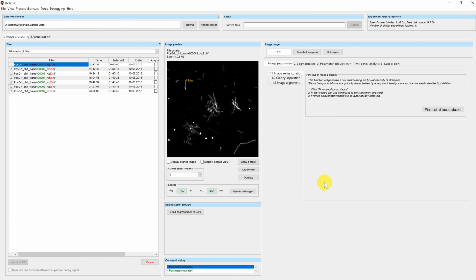Welcome to this tutorial on BiofilmQ. My name is Eric. Today I will show you how you can eliminate sample drift in your microscope images.